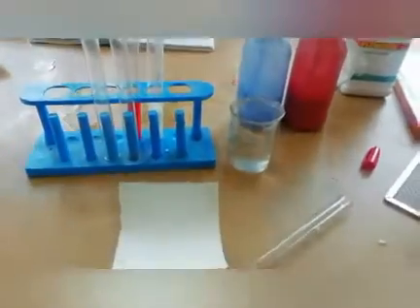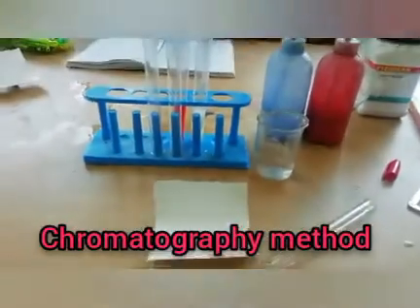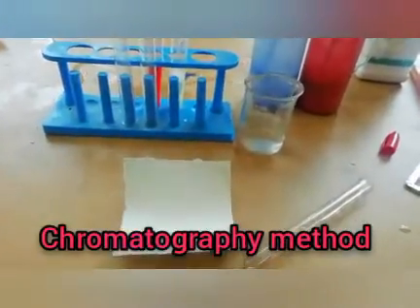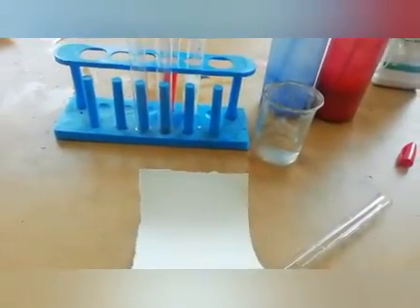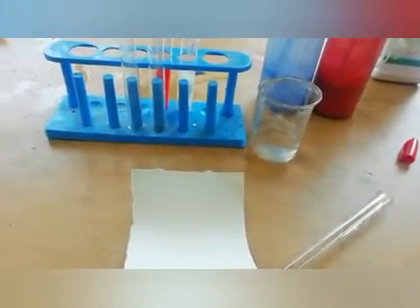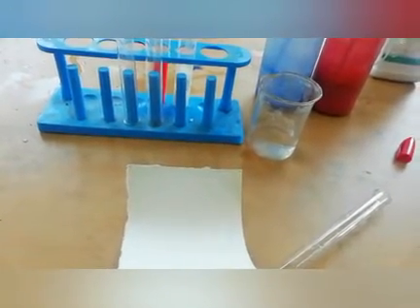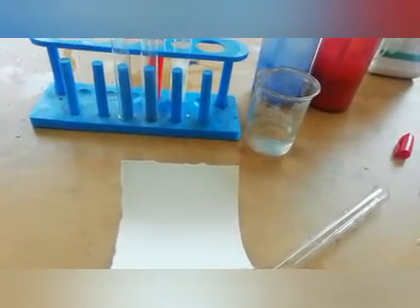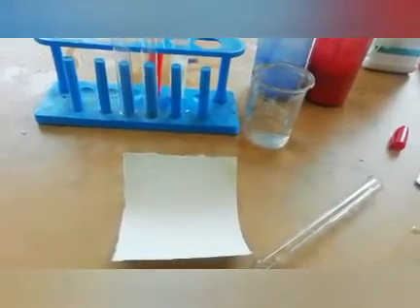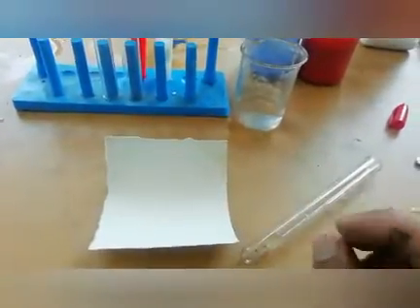Hello dear students, the third practical of separation methods we are doing is chromatography. The word chromatography comes from chrome, which means color. So nowadays the technique of chromatography is used to separate and identify substances, whether colored or colorless. Okay, so here we are going to try to separate the colored substances.